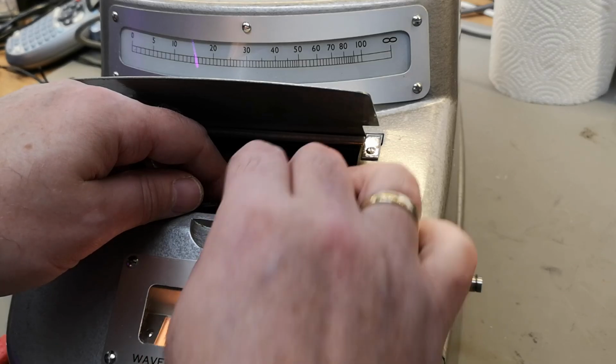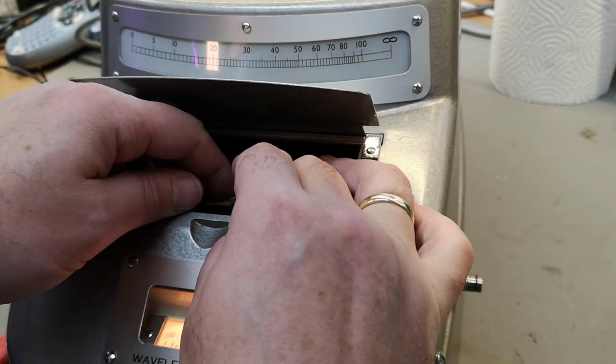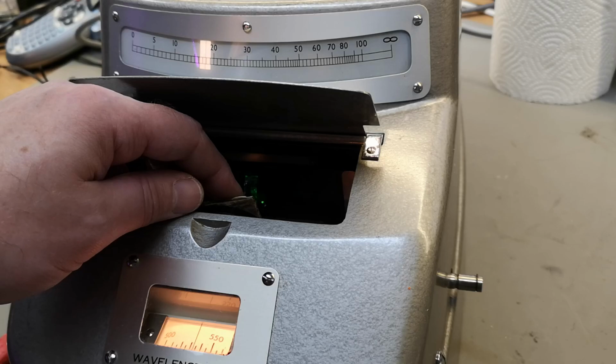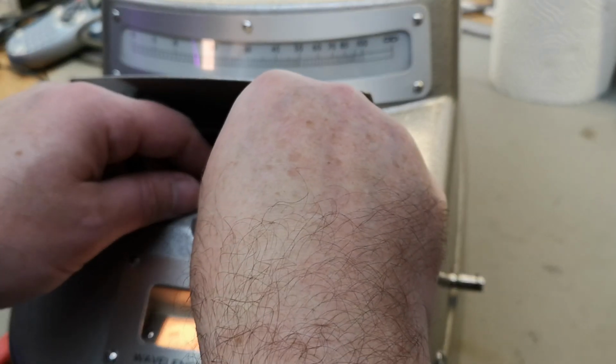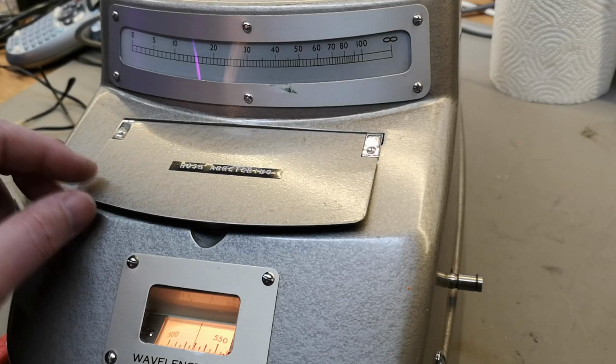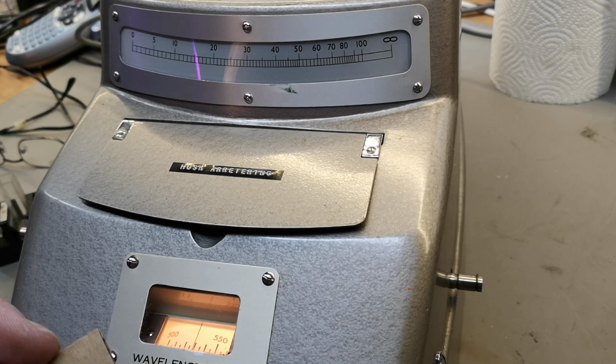but what I want is to find the peak. So I'm just moving it a little bit away from the maximum because I can't see anything if it's outside of the scale, right? So then I can dial around here. And then I can find the peak. Look at that. I mean, that is 530. It is that accurate. This thing is from 1960 something, right? And it is spot on. And the resolution is just insane, and sensitivity is super, super nice. I'm actually quite happy about this one.